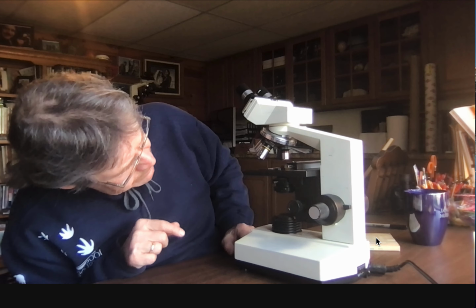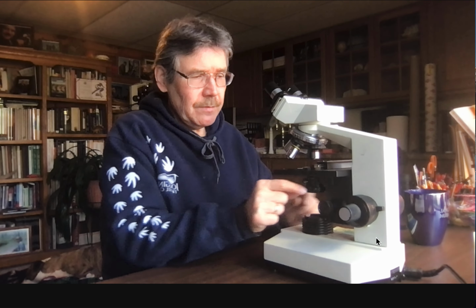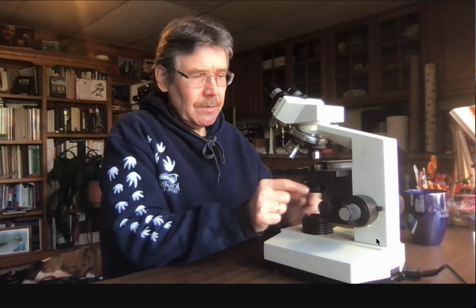Your iris, the colored part of your eye, is contracting and making a small pupil or a really big pupil. So in bright light, right now in the bright daylight at my window, my pupils, if you could see them, are pretty small. Because it's bright light, the iris is closing down and I've got a little bitty pupil I'm looking through. It has to do with the physics of light, but you like to close that light down using the diaphragm.